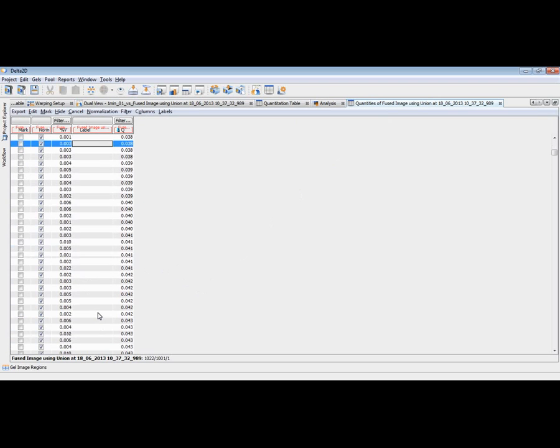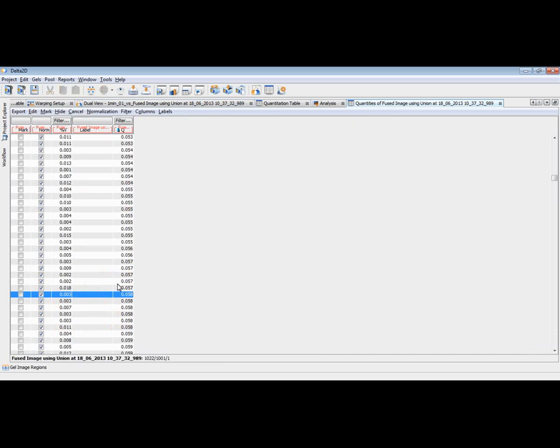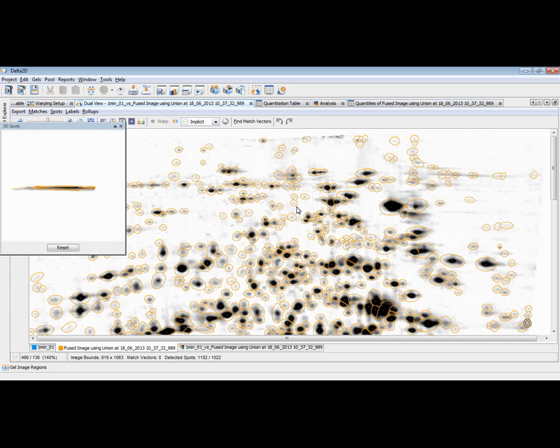So maybe in this table, we get up to qualities of this. This is still a very weak spot. I wouldn't consider this to be a spot. We can, of course, use a roll up, like the 3D spot roll up, and then check the spot whether it's a signal or not. It's a very flat signal here, so I wouldn't consider this to be a spot. So let's look for even larger spot qualities, like this. And once I see, okay, now I would say this is a spot. It's starting with this spot quality.